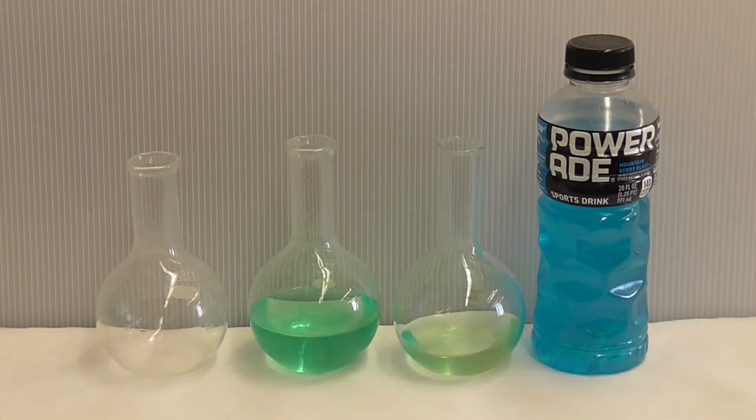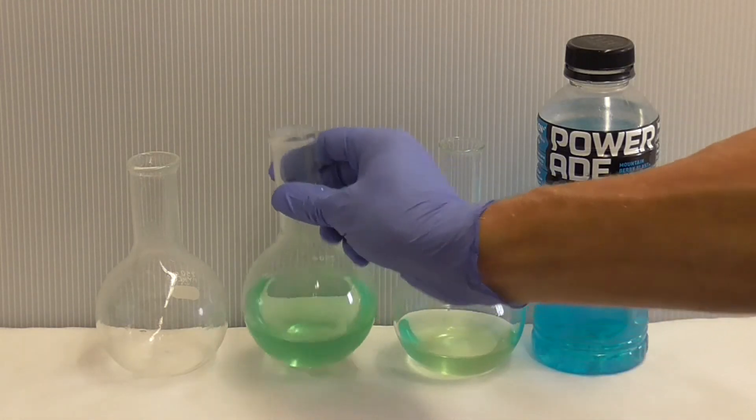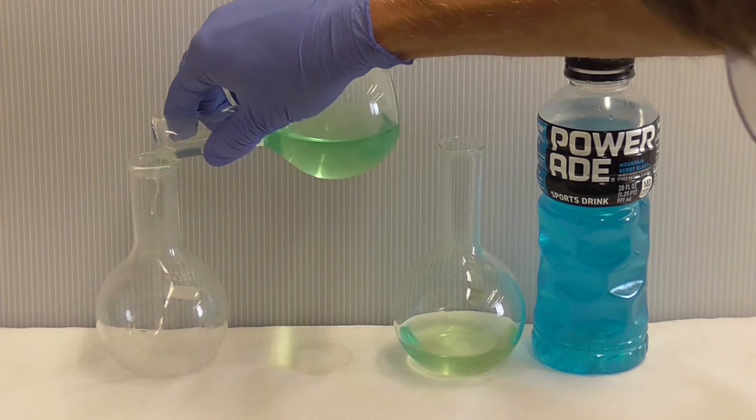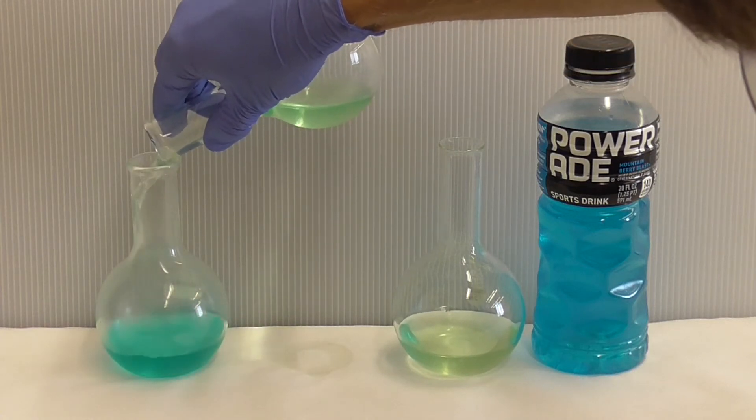Now that's faded to maybe a green. I'm going to take this flask here and pour it into this one. Yep, there's a blue color again.